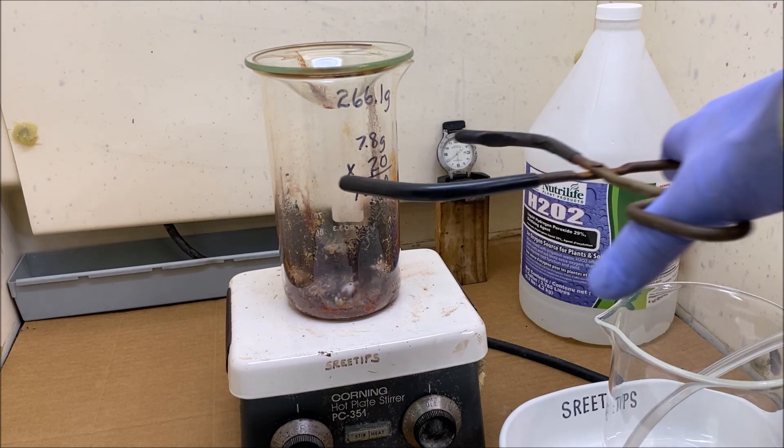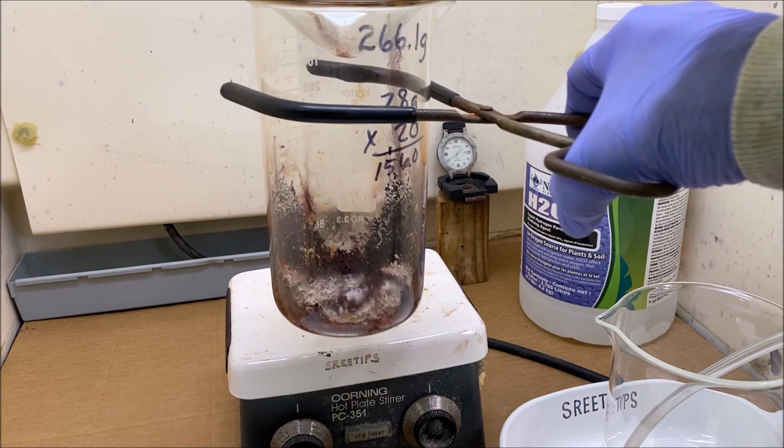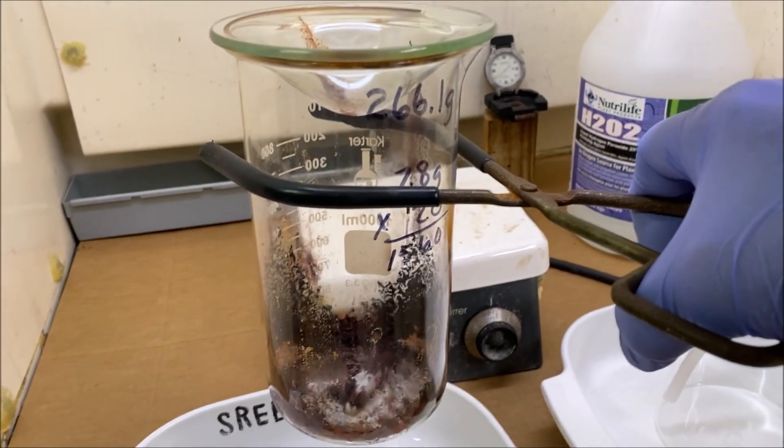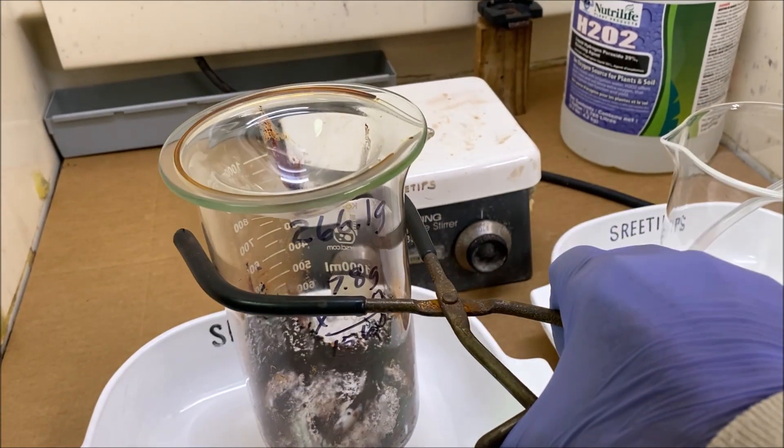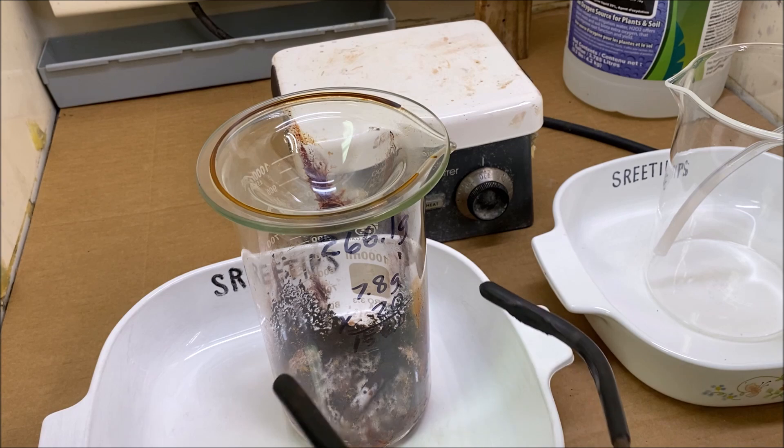Well, I got busy doing something else, wasn't paying attention, and I boiled it down to dryness. I've allowed it to cool off to ambient temperature. Now we're going to sit it down here and figure out what to do next.